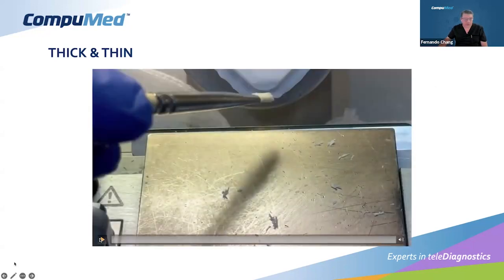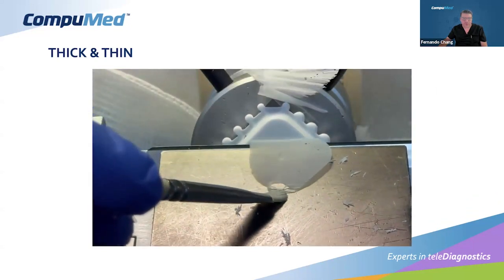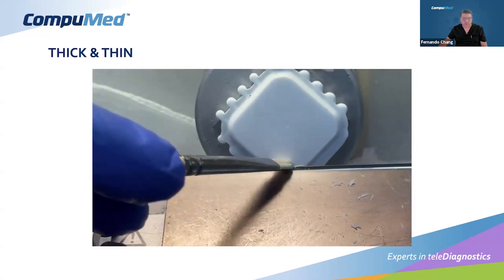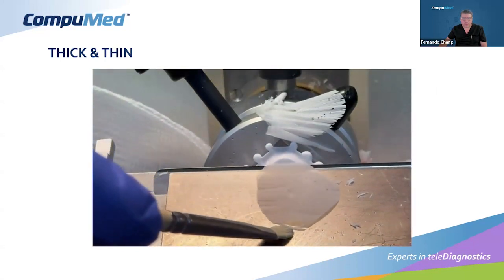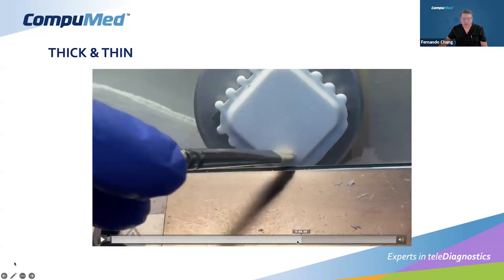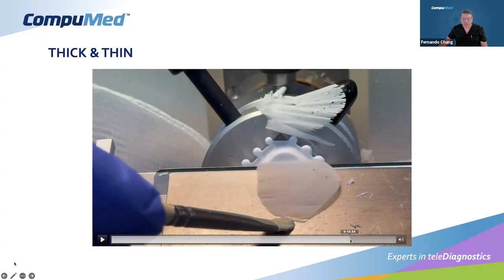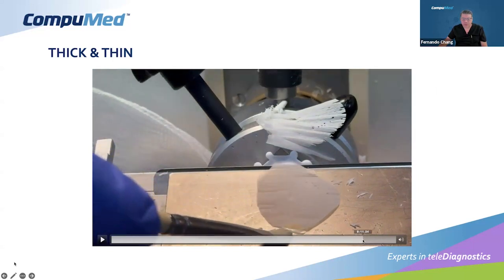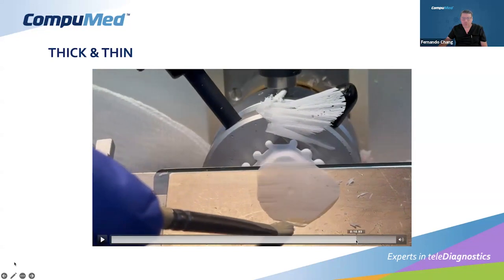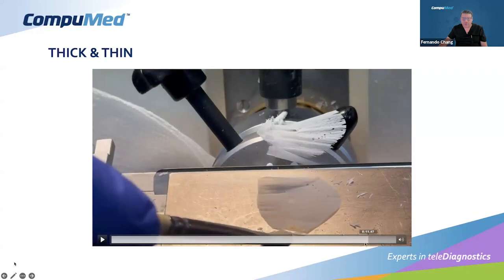This is an example of the thickened section. We're going to come back to that. And then the top. I want you to focus on the top. Okay, so in this sample you can see how the section goes, and how flat it is. There are little holes there. It's not tissue, but you can see the top. The top is really thin. It's thinner than the bottom, as you can see.